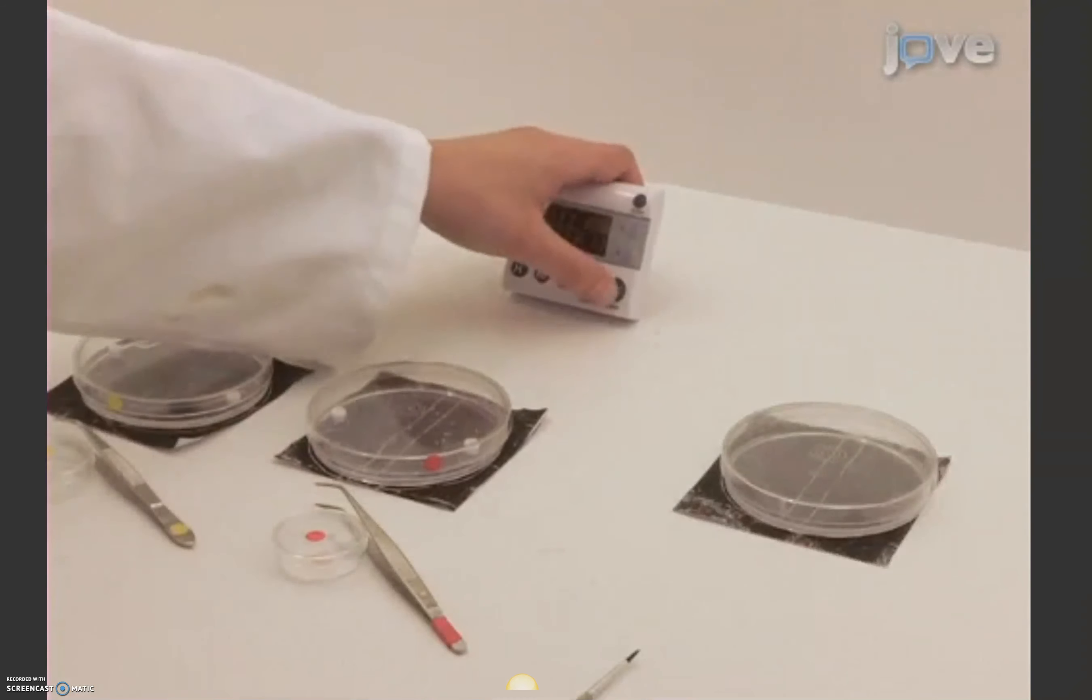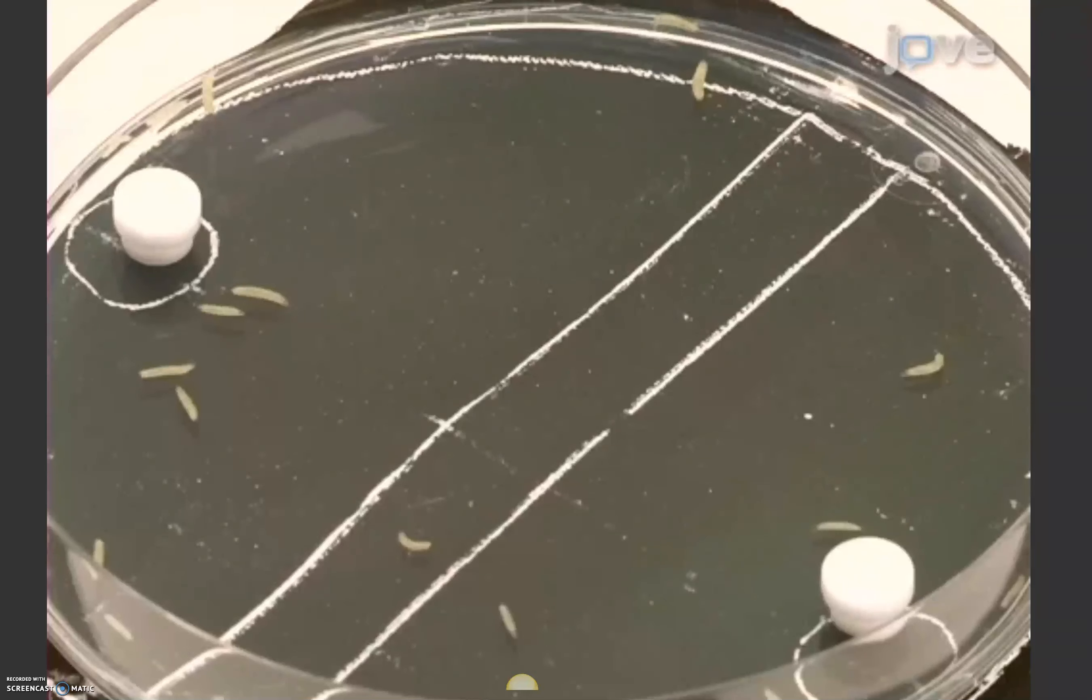Once the larvae are transferred, close the lid and allow the animals to explore for 5 minutes. When this time expires, the first round of training has been completed.